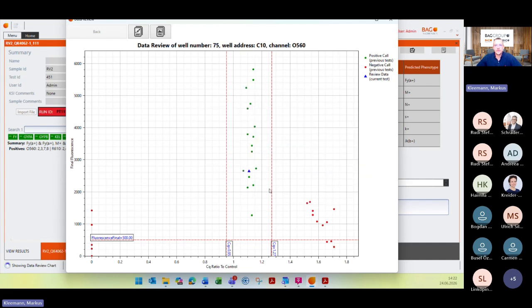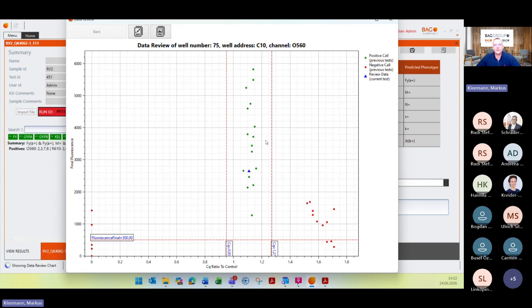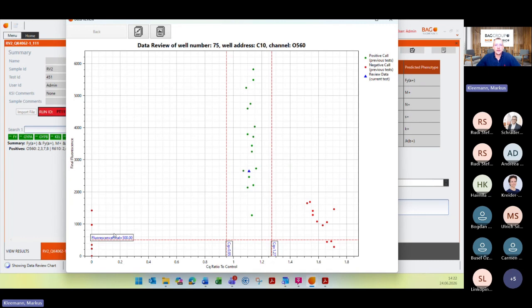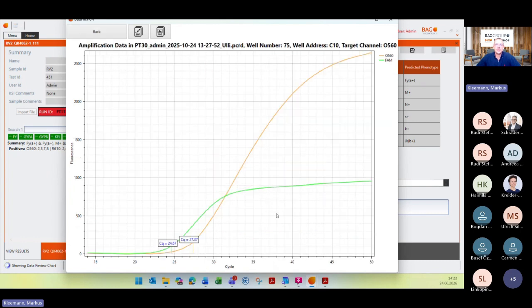You will find different colored points here. We have here in green, somehow in a data cloud, these green points, which are positive reactions from different samples which you have run with the same kit file, and which is for the same reaction here. In blue, you can see your reaction. Actually, this one I have double-clicked on. And in red, you can see here and here the negative calls. When I double-click here on this blue dot, you can see the target fluorescence, the target amplification curve, and here in green in the FAM channel, the internal amplification control.